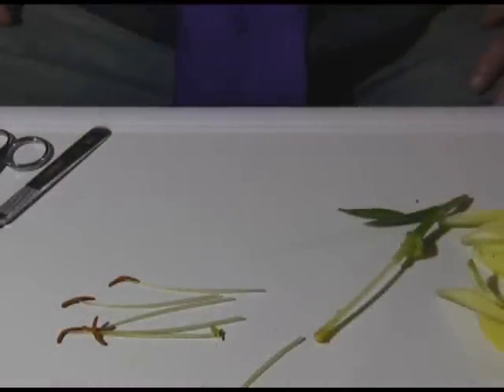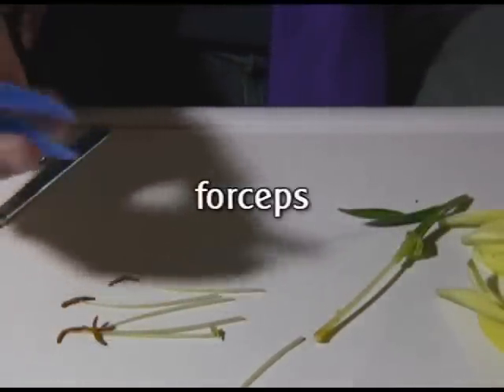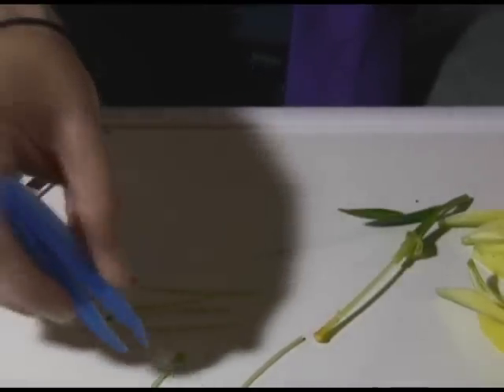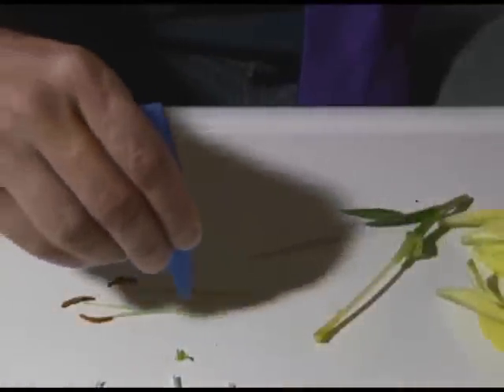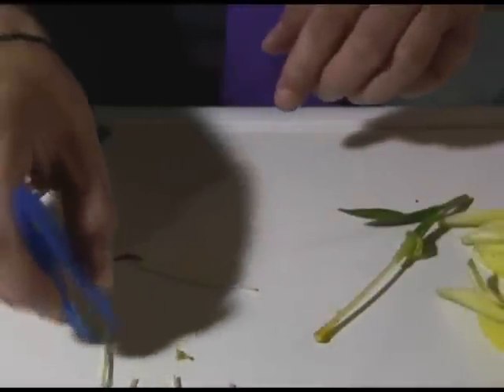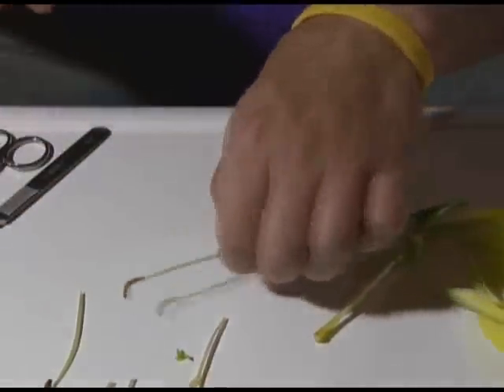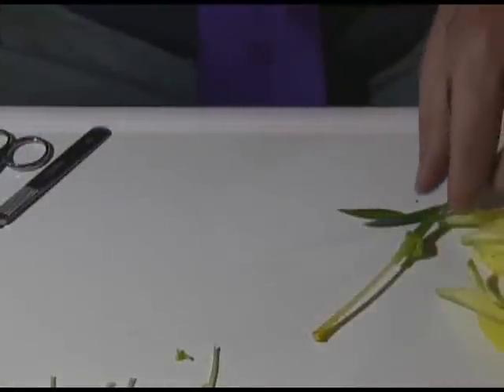Now one piece of equipment that I didn't show you before that's going to come in handy — commonly people call these tweezers, but they're really forceps. These are a cheap pair but they'll do the job. So we can just adjust these stamens here and put them in a nice little row so we can see them. We're going to take a closer look at these under the microscope in a bit.